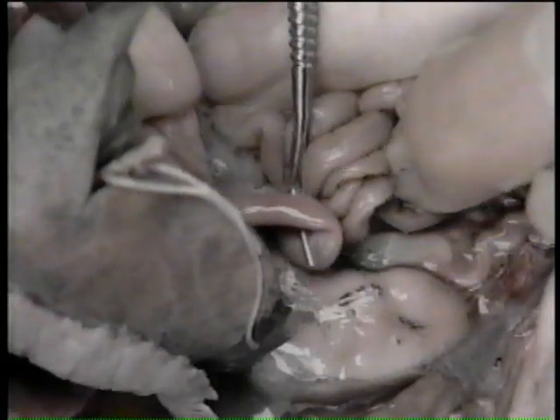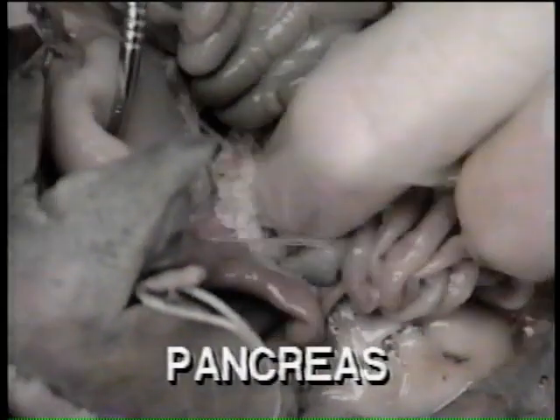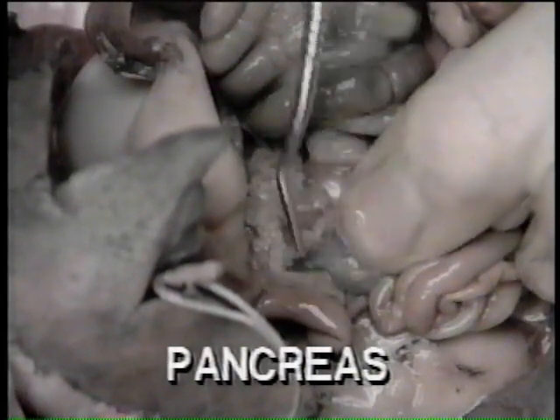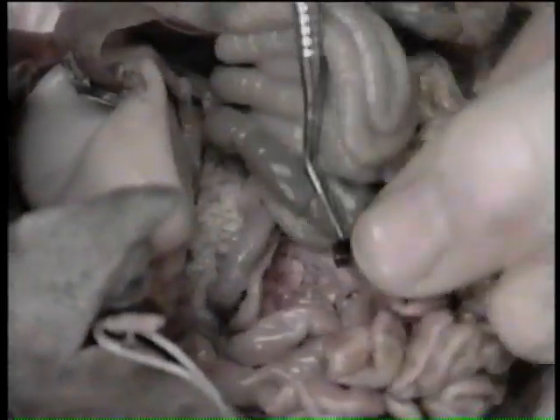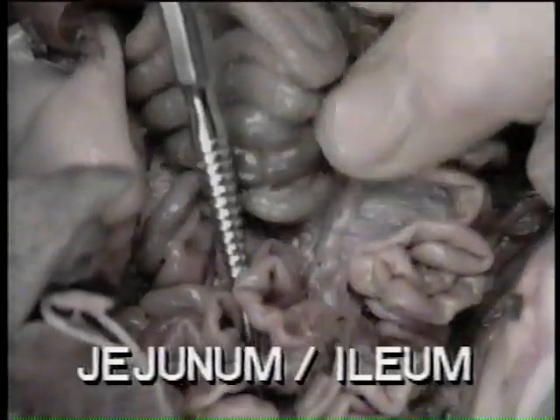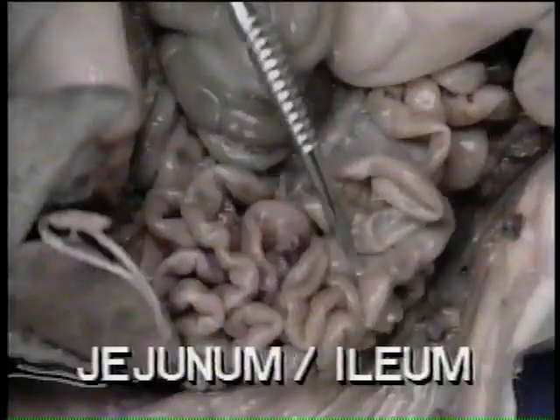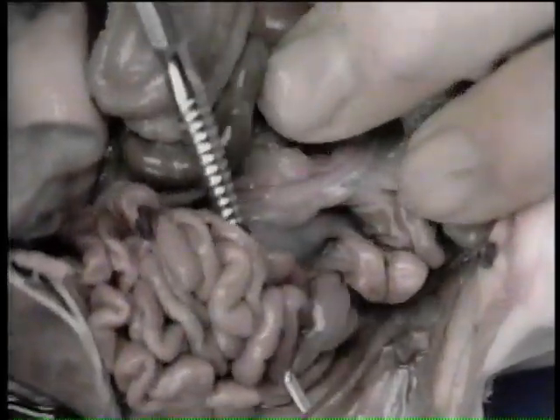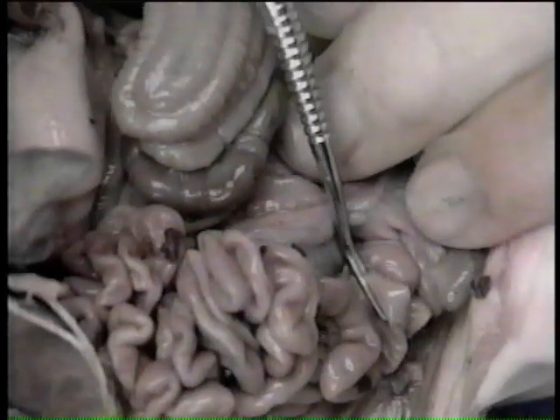The pancreas lies between the stomach and the duodenum. The jejunum and the ileum are the two regions of the small intestine extending as far as the large intestine. In this examination, they cannot be differentiated from one another.